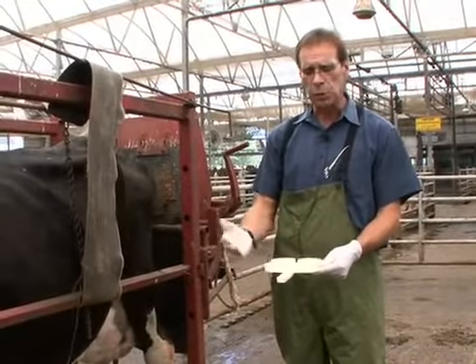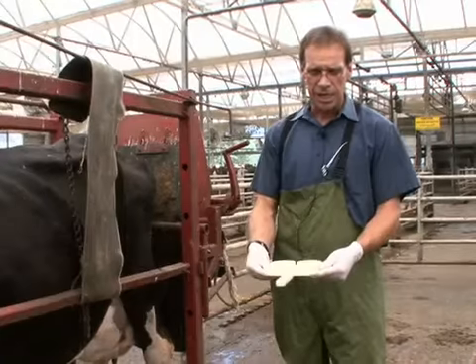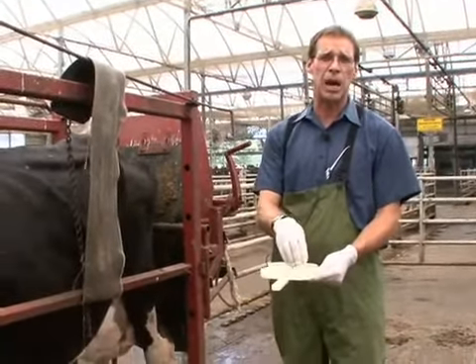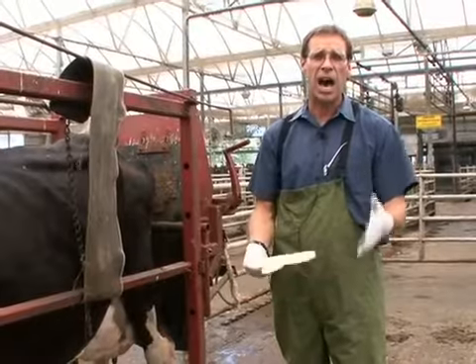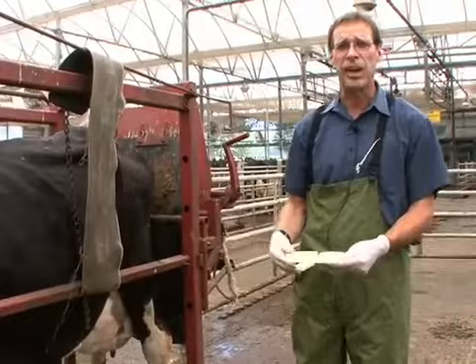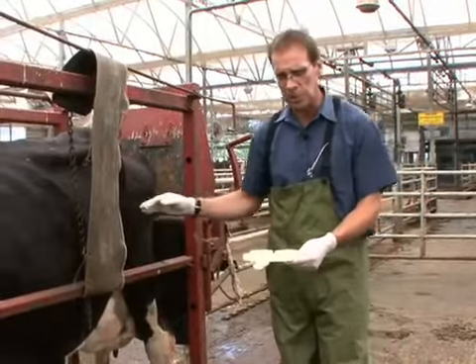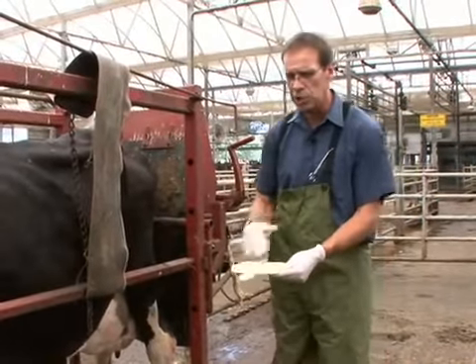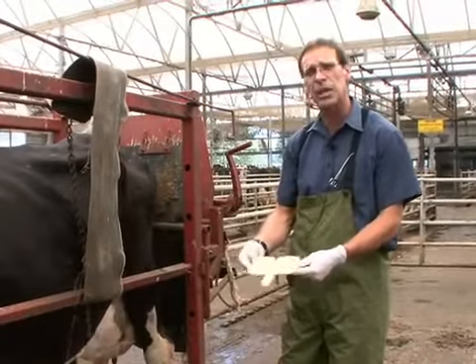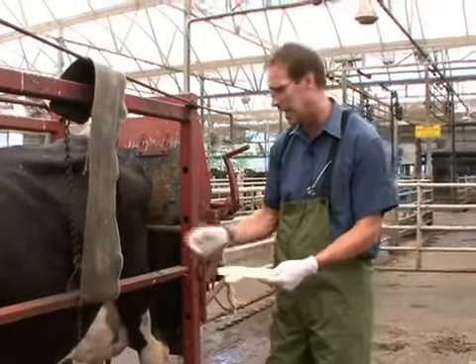So the result when we read this examination is the stickier or the tackier or the thicker the solution becomes, the more likely we have high somatic cell counts, indicating that animal may have infection in that gland. So I will demonstrate taking milk and putting it in each of these wells and then adding the reagent and testing this particular cow with the California mastitis test.